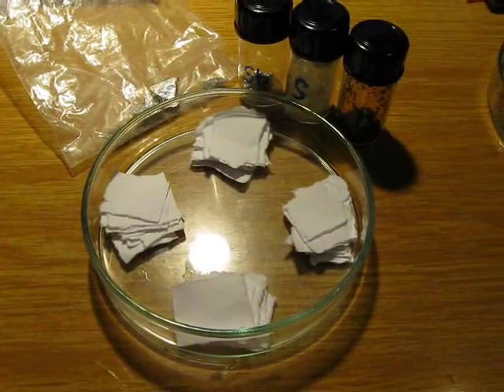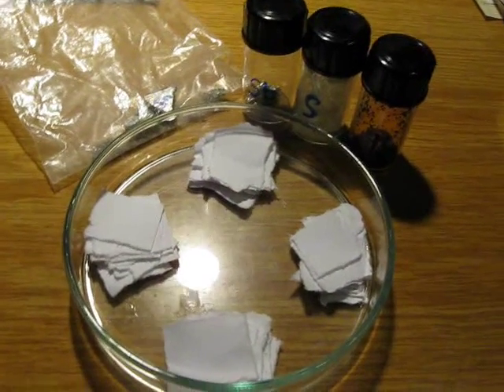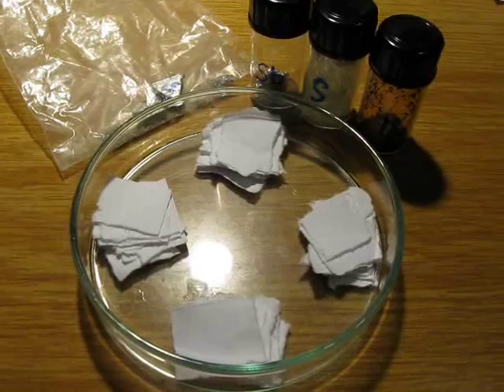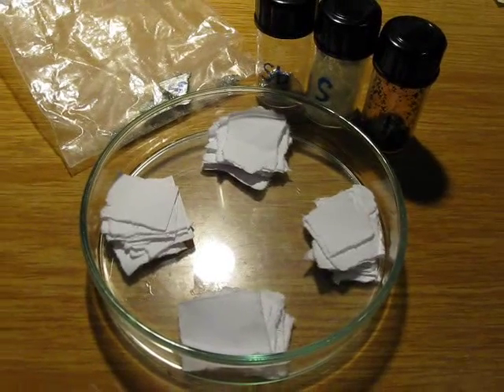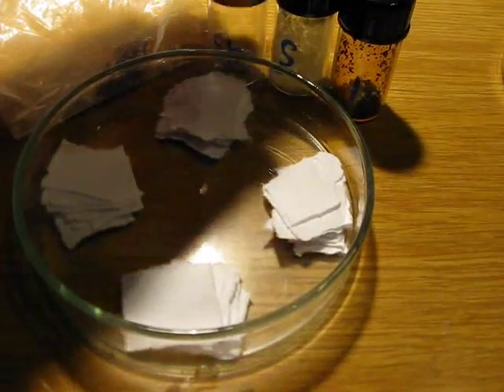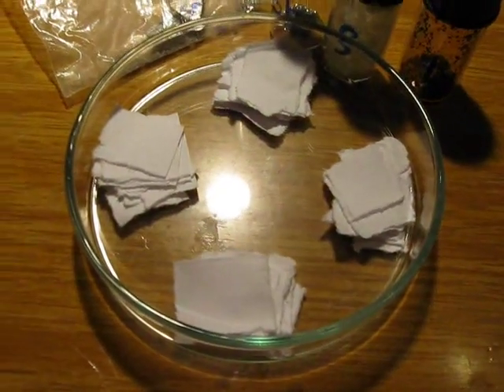Yesterday I accidentally created a weird chemical burn, which started to fade already, but you can still slightly see it there, while handling tin, antimony, sulfur and iodine. Today I want to see if I can reproduce that burn by putting a sample of each of those elements onto a stack of 10 pieces of paper.